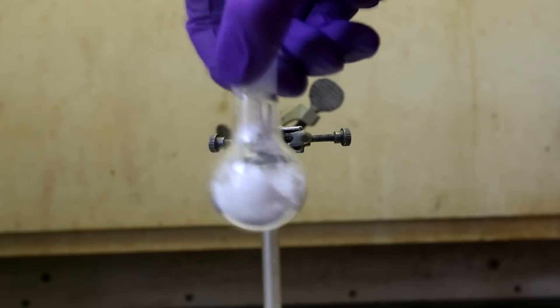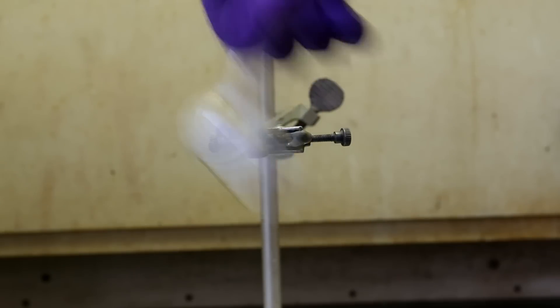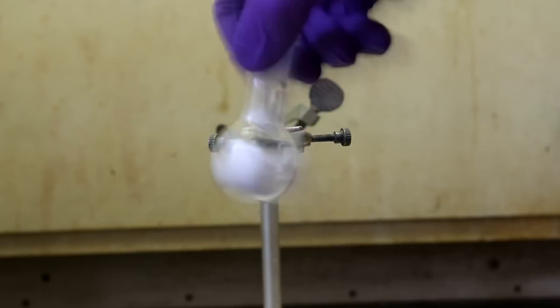The sodium bicarbonate is added to neutralize the hydrochloric acid that is liberated when the lysine hydrochloride is heated.